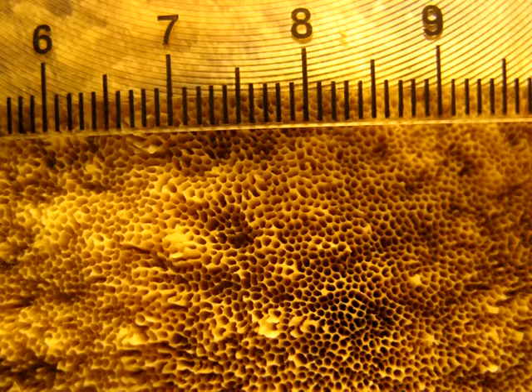The diameter of pores is an important identifying feature. However, only the average number of pores per 1 mm of hymenophore surface is indicated in reference books. This value is usually calculated by routine counting using a magnifying glass or enlarged photographs.